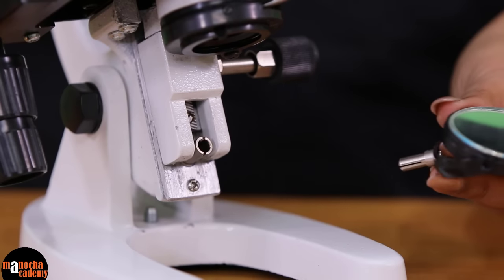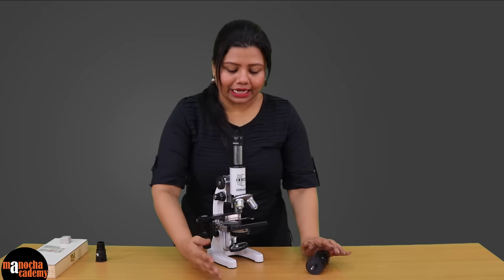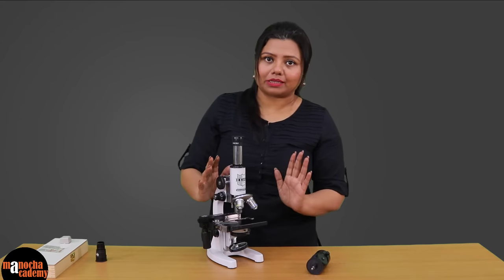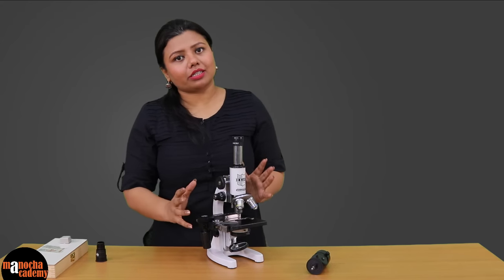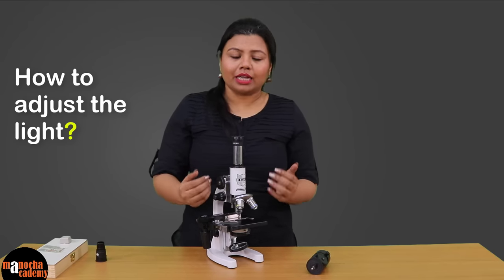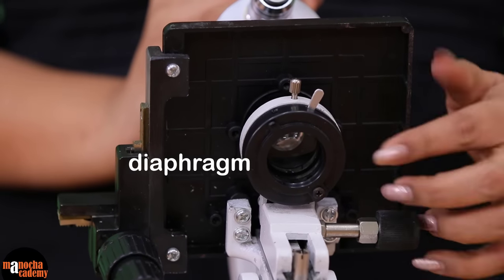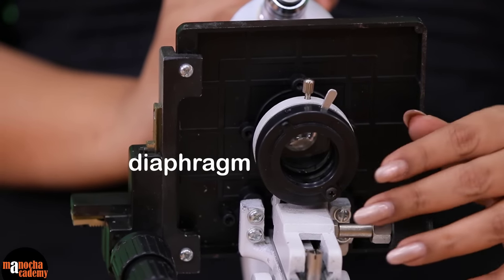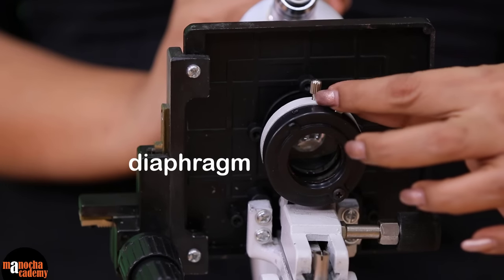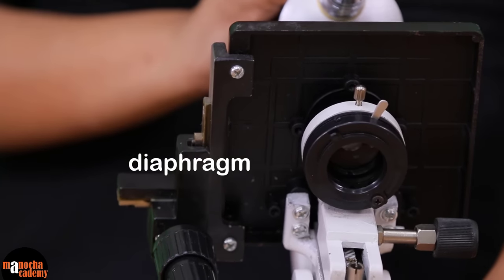We attach the mirror to the base of the microscope so that it can collect light from different directions and send it onto the specimen. If you want to adjust the amount of light entering — for example, if the microscopic field is appearing too bright — we have a diaphragm which you can rotate to adjust the amount of light. This diaphragm is almost like the iris of your eye: just as you decrease or increase the diameter of your pupil, you can do the same thing with this diaphragm.